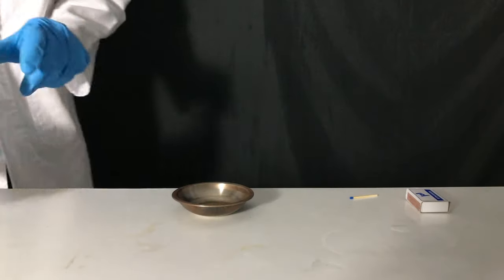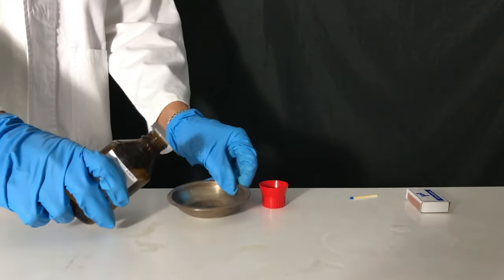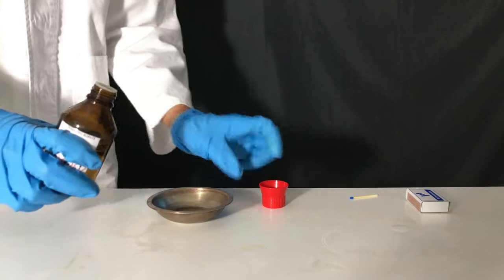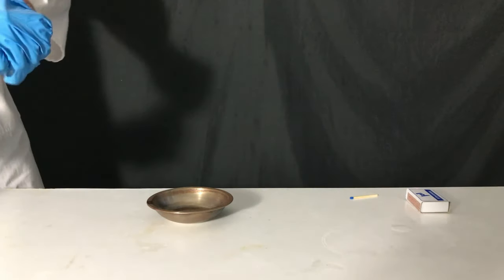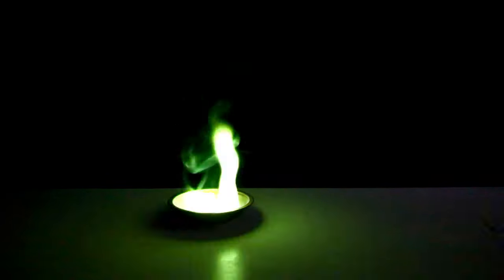The more concentrated tri-methyl borate was way more interesting. Again it was added to a burning dish. The lights were turned off and we lit it on fire. The green flames were way more intense and a lot of smoke was produced. The smoke consists of boron tri-oxide and should therefore not be inhaled.